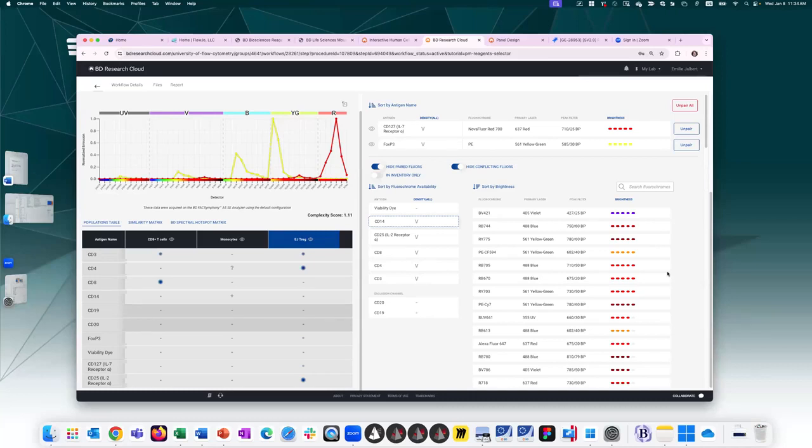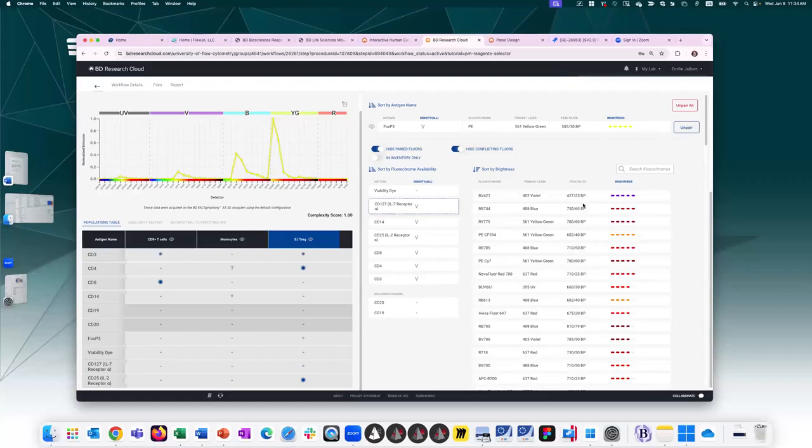Your mind might work a little bit different. Maybe you want to start with co-expression first and then play around with brightness as a secondary factor. You know, that's why we have tools that you can play around with. You can add things, remove things. So let's say I didn't like this pairing of CD127 to Nova Fluor. I can unpair it and then reselect something else.